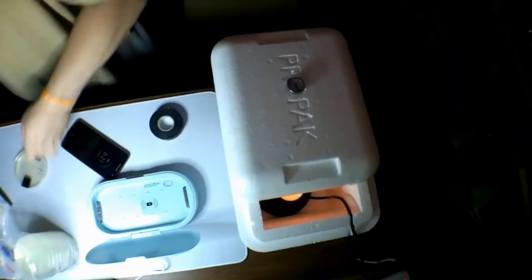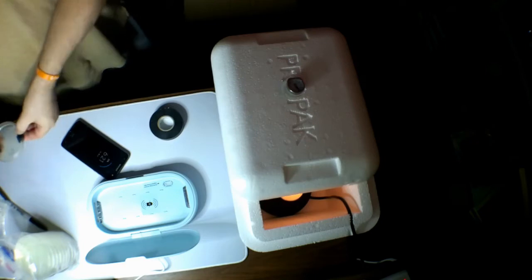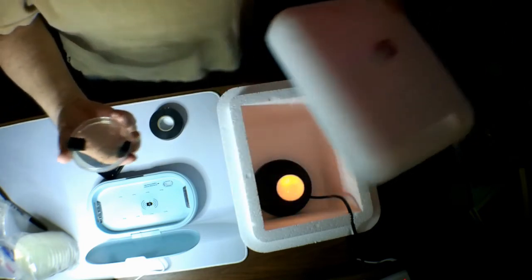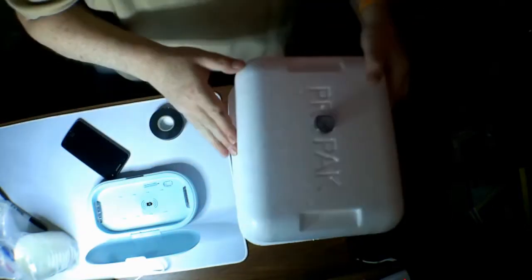C1. Alright, I'm going to drop this in the incubator. If you want to call it an incinerator, might be incinerating some bacteria, but I don't think so. This is C1. Everything 1 will be the dirty one. Alright, C1 is in the incubator.